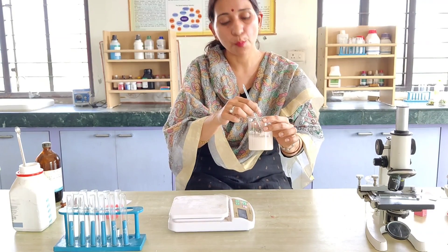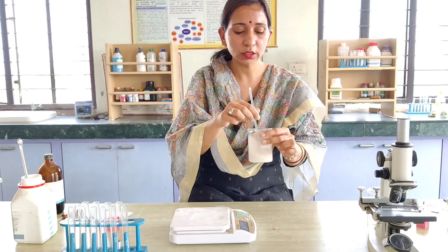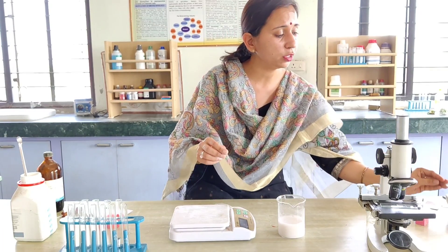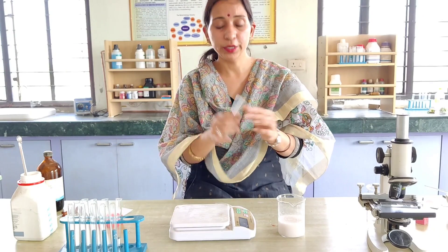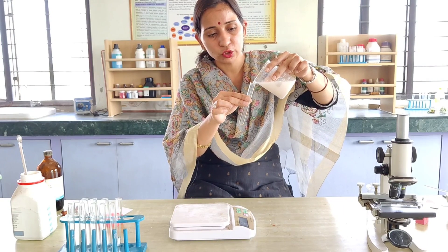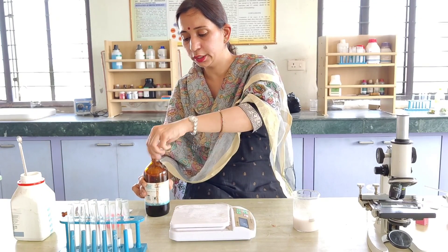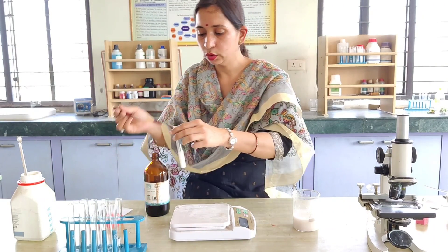Salivary amylase is the enzyme present in our saliva, and its function is to break down starch into disaccharides. To demonstrate this, we take the starch solution into a test tube and add a few drops of iodine solution — just one or two drops.